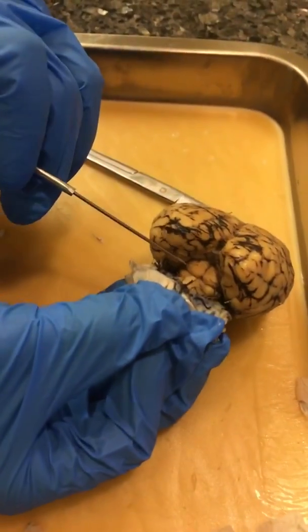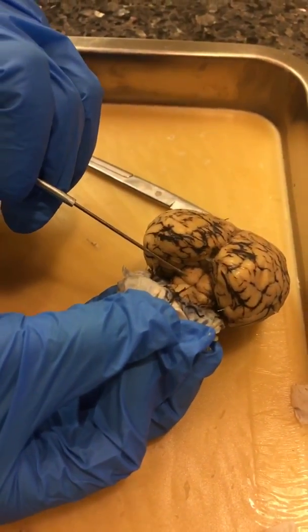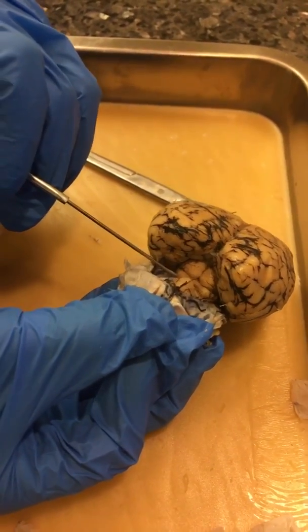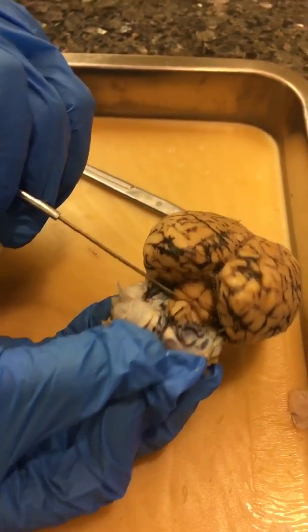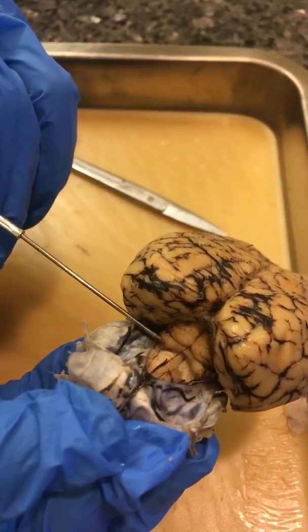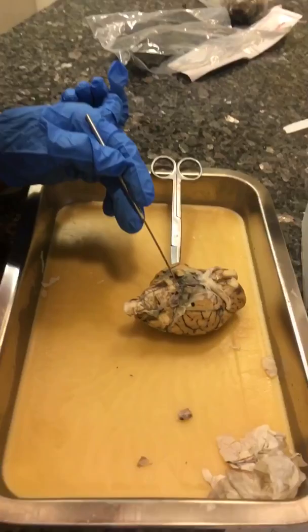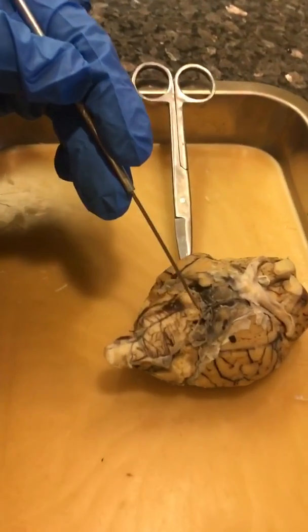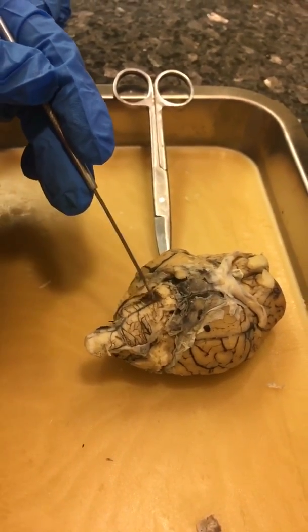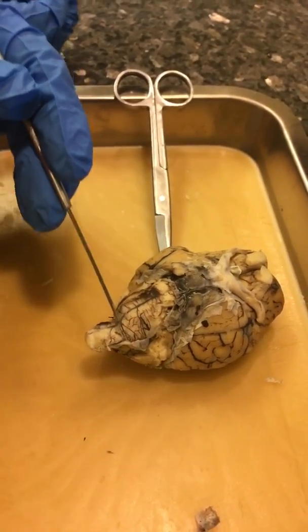Here we have the superior colliculus, and here we have the inferior colliculus. Here we have the pons, and this is the medulla oblongata.